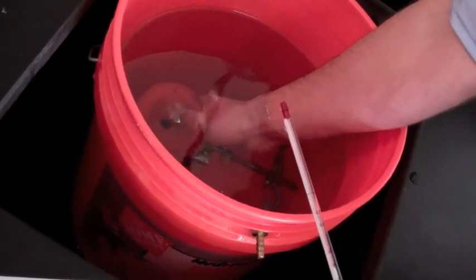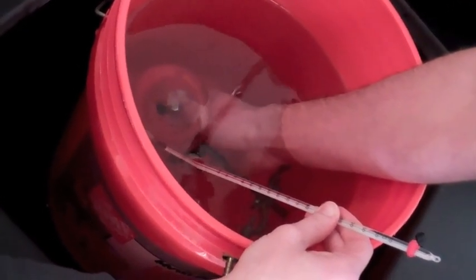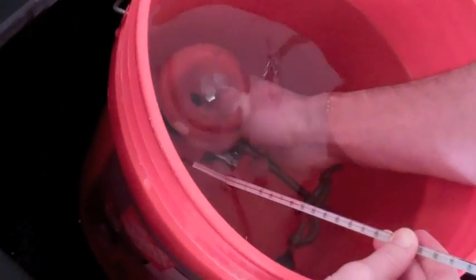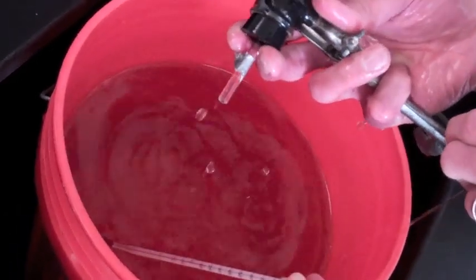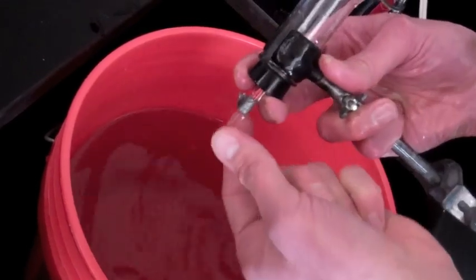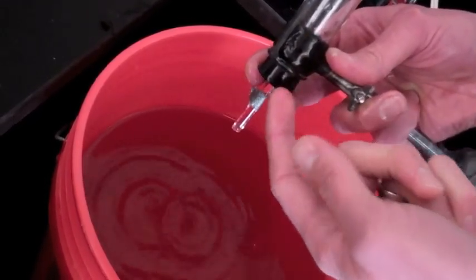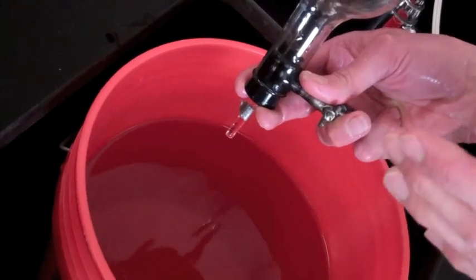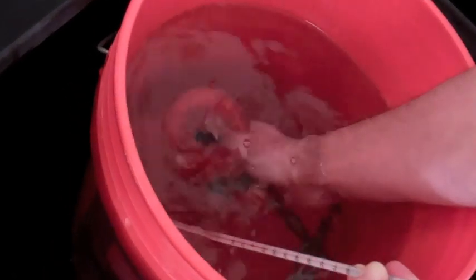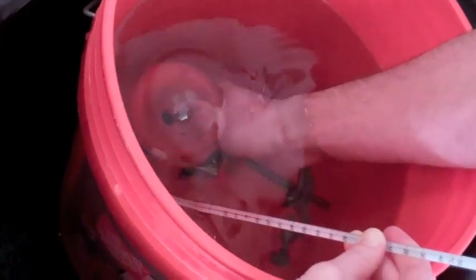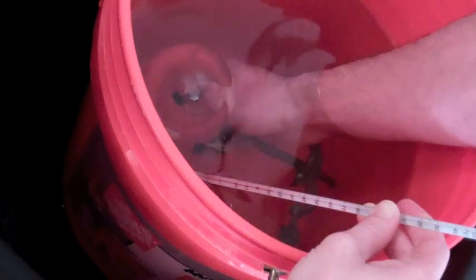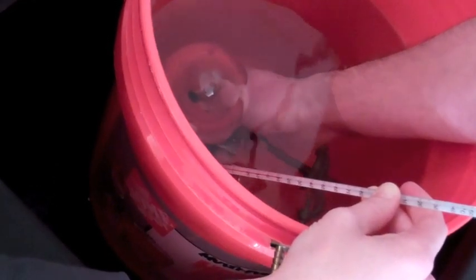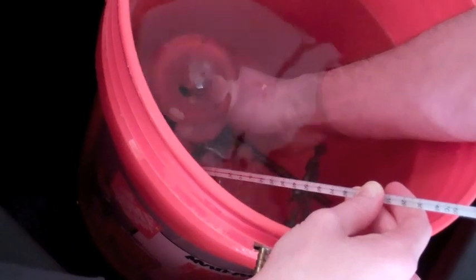And we're back. We're ready to measure the temperature of the ice water. And while I do that, maybe Mr. Phipps, you can talk about how you've put your hand into the water? I'm getting ready to pull the glass rod out. Let me take this out just for a moment to show you how I'm going to hold it. I'm going to hold two fingers over to keep the stopper in place so that I can pull out just the glass rod. This lessens the chance that any air escapes from the flask. With it submerged and it's been here for five minutes, it should be at equilibrium with the temperature of the ice water. For our demonstration purposes, we didn't keep too careful track of the ice, so we've got a temperature that's a little higher. It's about 12.9. We're going to record that temperature.